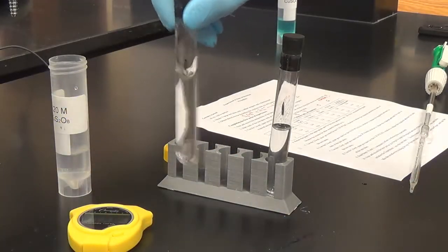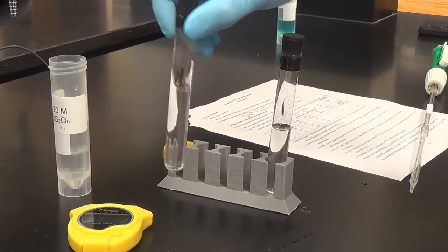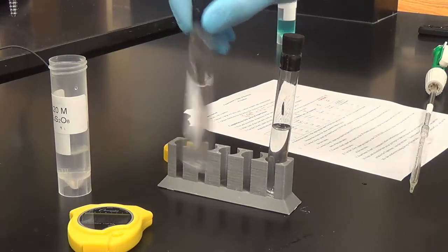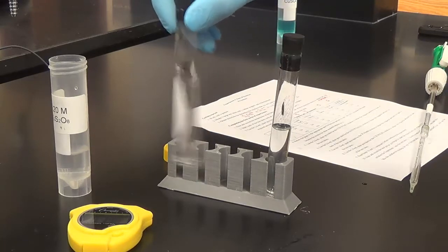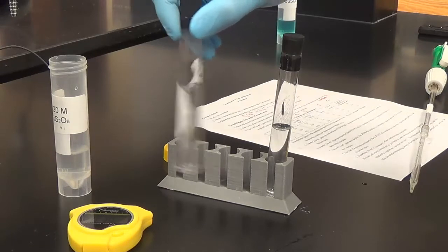Just watch this. We're looking at something that's around 2 to 4 minutes. Everybody's lab group will be a little bit different, because not everyone's going to pipette exactly 2 mils, and all sorts of other things can go on. But we're looking for something in 2 to 4 minutes for experiment 1. Again, it may vary from different labs.